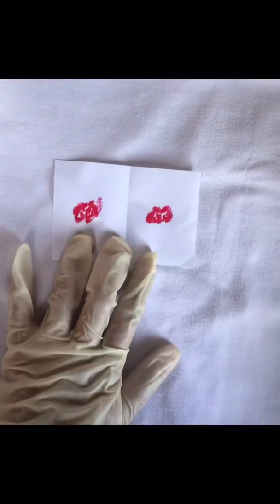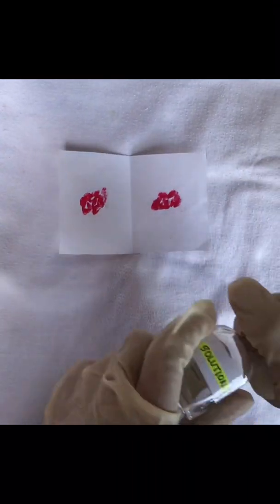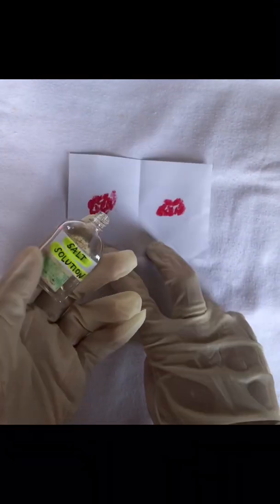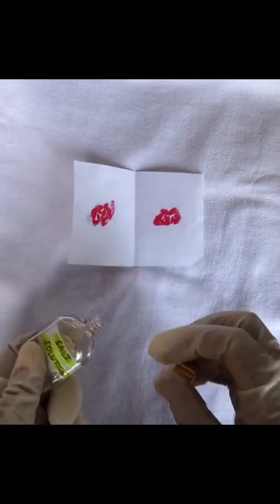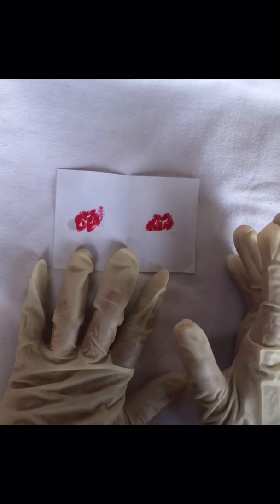We will take two small portions of dried blood and we will place each fragment as a separated drop of 0.9% salt solution. We will cover it to prevent evaporation and we will wait for 1-2 hours.